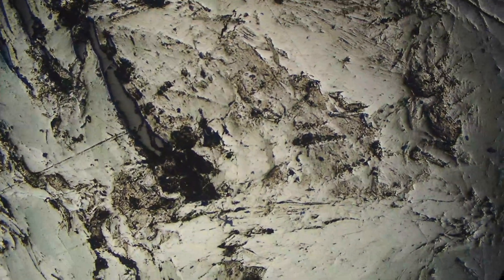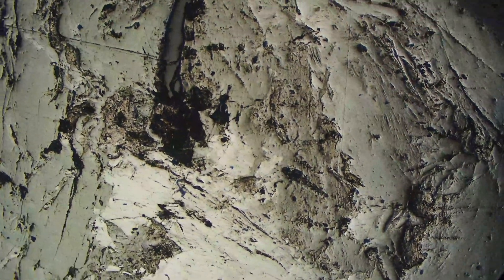This is showing another kind of form of molybdenite where we have almost sprays of molybdenite that you can see, especially on the left now.